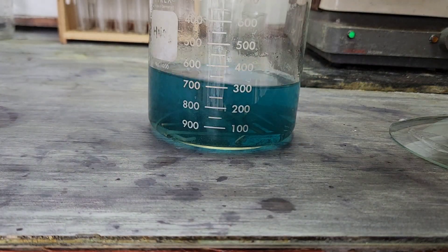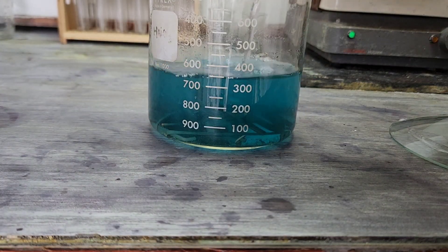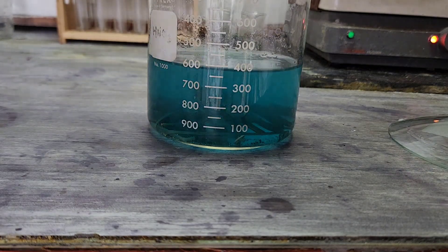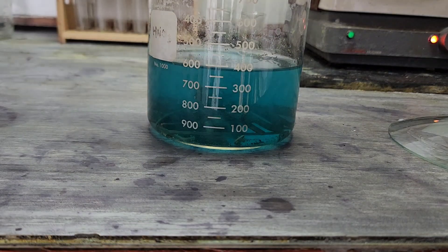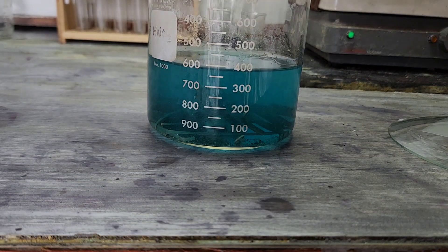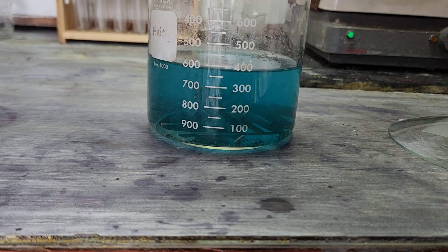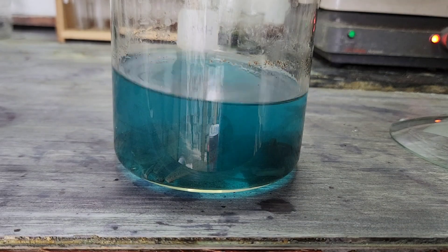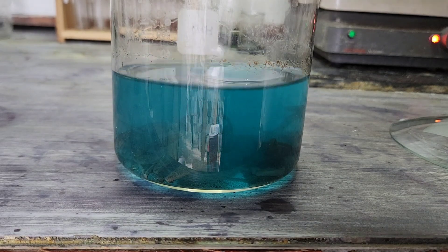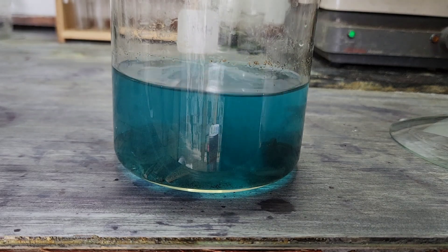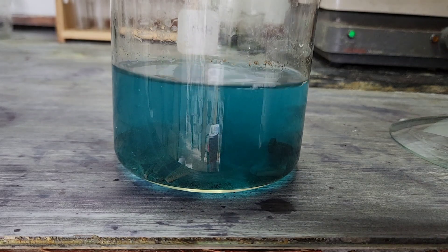Let's go ahead and top it back off to 400. See if we can cool that solution down a little bit before we put some nitric in there. Add a little nitric, see how this reaction is going to take off. Nothing crazy.